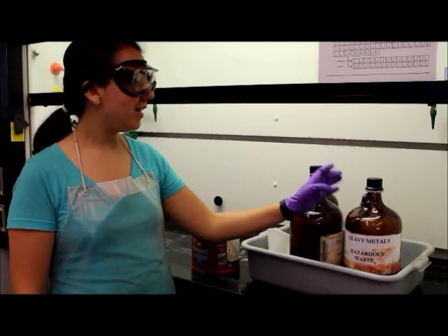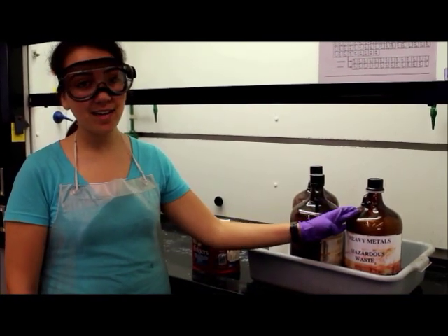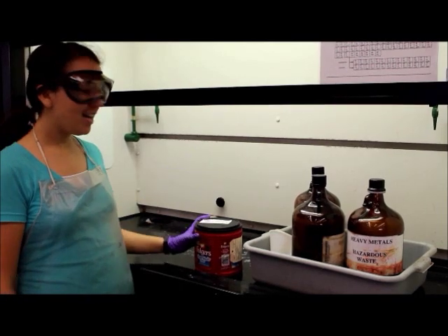For this experiment, you'll want to put all your liquid waste in the heavy metals waste container and your solid waste in the solid waste container.